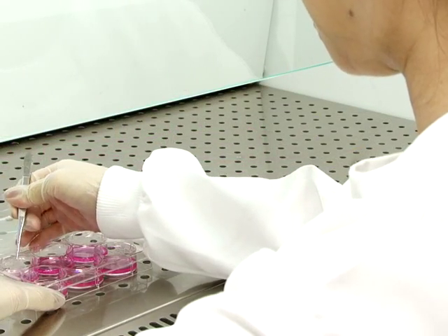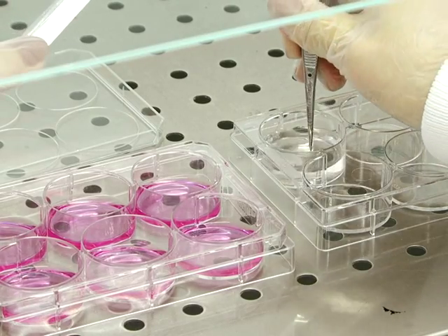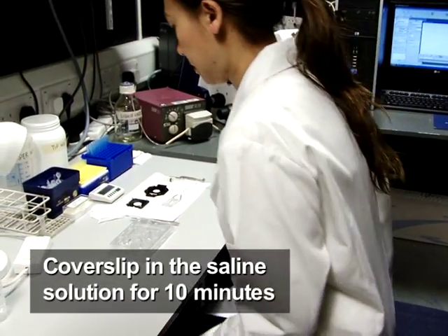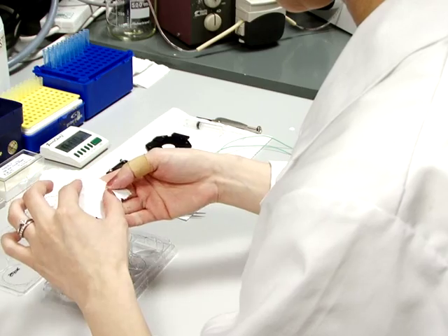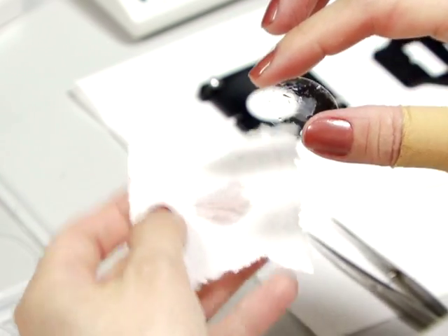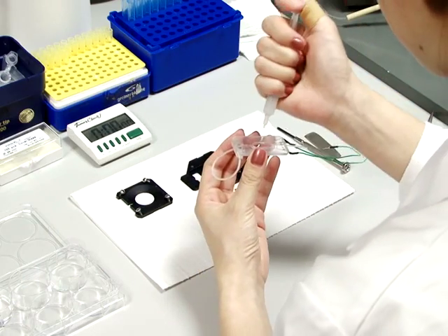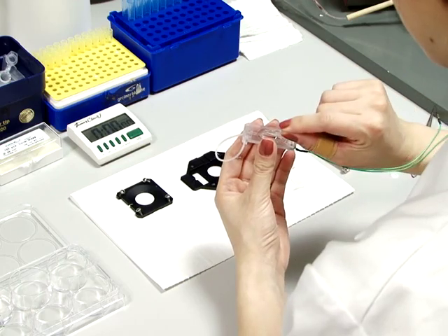After 7 days, place a single cover slip in the saline solution at room temperature for 10 minutes to allow stabilization in the new medium. After that, remove the cover slip. Dry its underside and the area surrounding the attached cells with a small piece of paper towel or absorbent paper. Subsequently, use the silicone grease to glue the cover slip to the bottom of the imaging chamber.